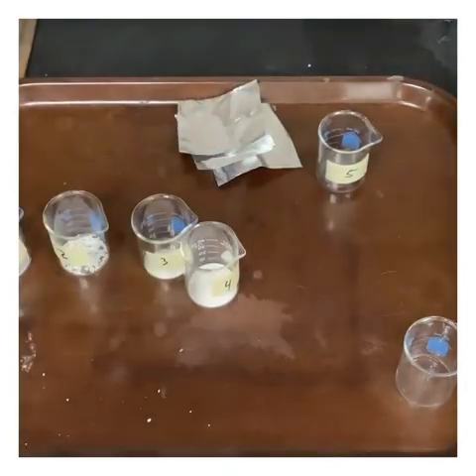If the sample melts, it means that it's melting at 540 degrees or less, which we're going to define as a low melting point. If it never melts when it's on this hot plate, it means it takes something much higher than 540 degrees, which we're going to call a high melting point.